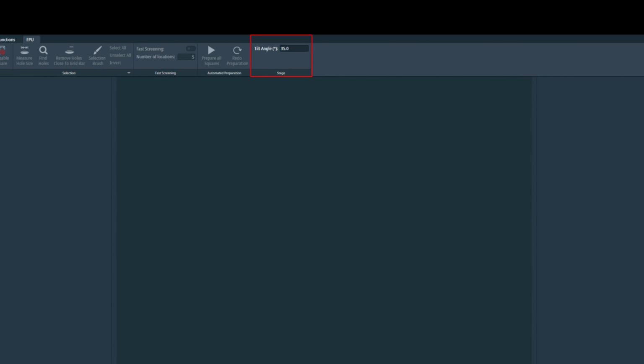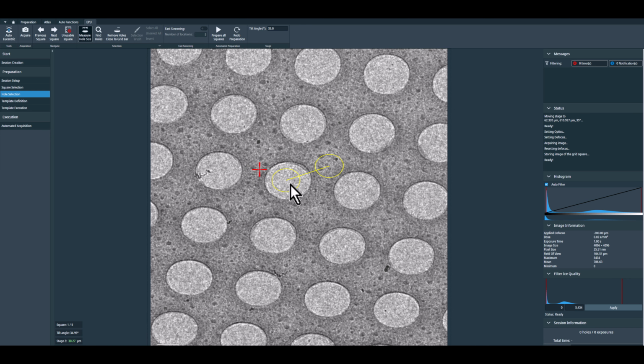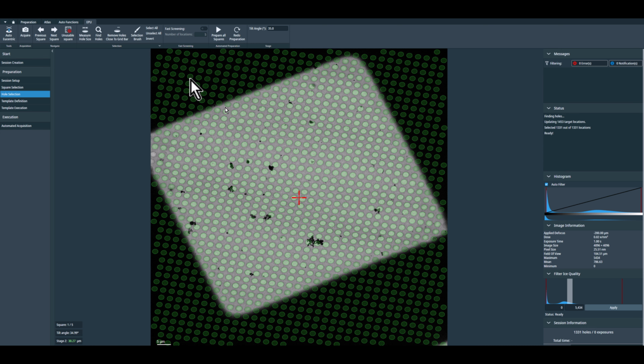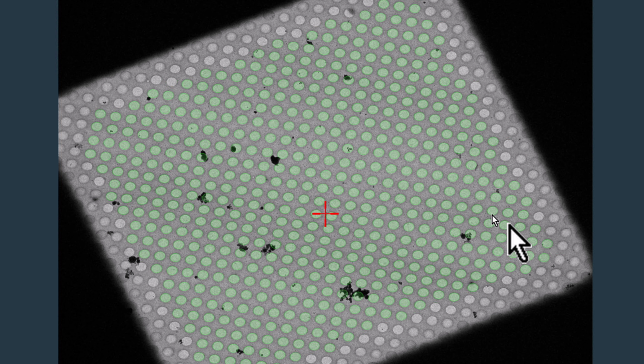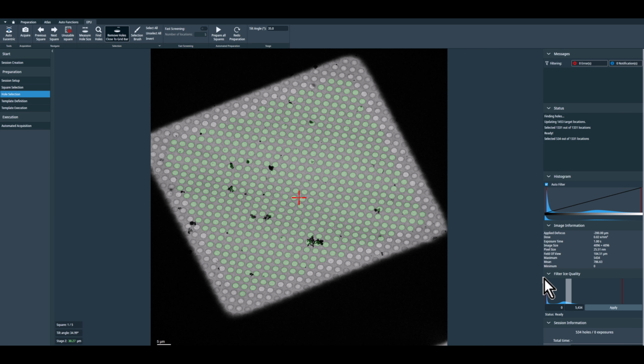Type in the angle you want and EPU will estimate how the holes look when tilted. Instead of a circle, you see an oval shape on the screen. And the same applies when you click Find Holes. The detected holes will also appear as ovals. That's it, simple trick, but it can make a big difference in overcoming preferred orientation.